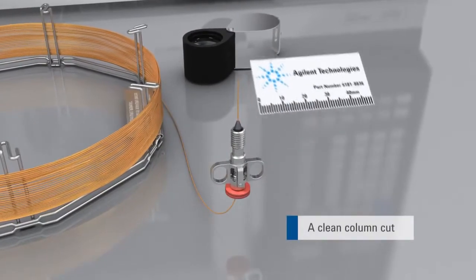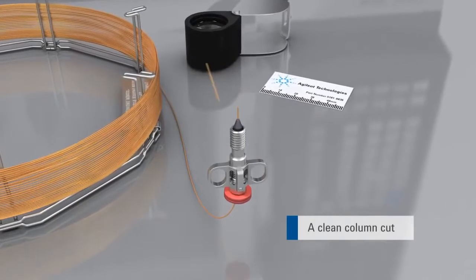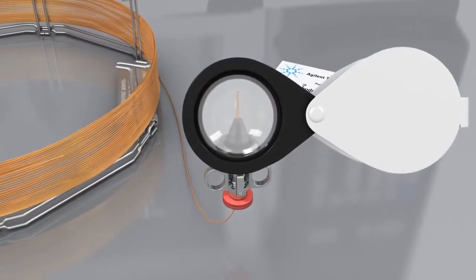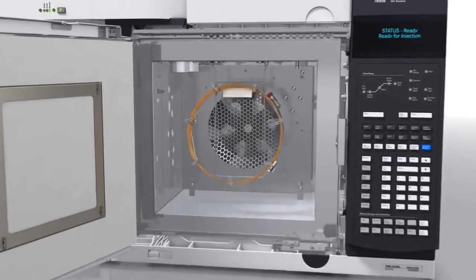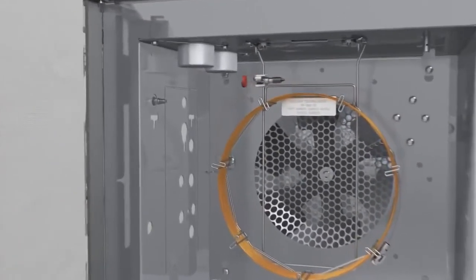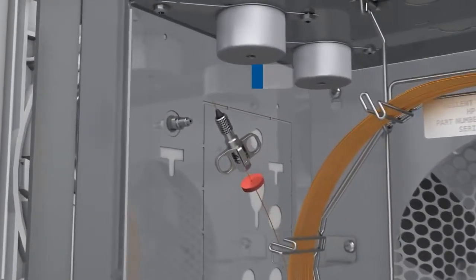Carefully trim the end of the column using a column cutter. Ensure the column cut is at a right angle to the tubing wall and that the end is free of chips, burrs, or uneven areas. The height or length of the column in the inlet or detector impacts peaks and results. For the 7890 splitless inlet, 4 to 6 millimeters is recommended.